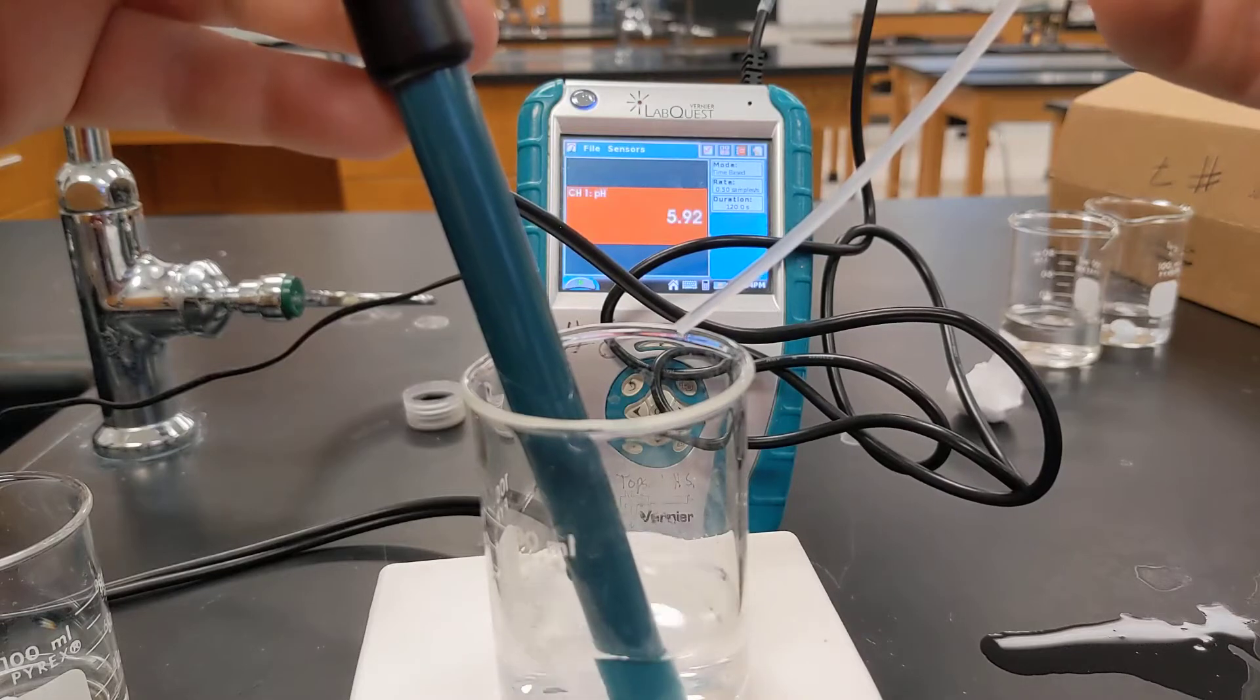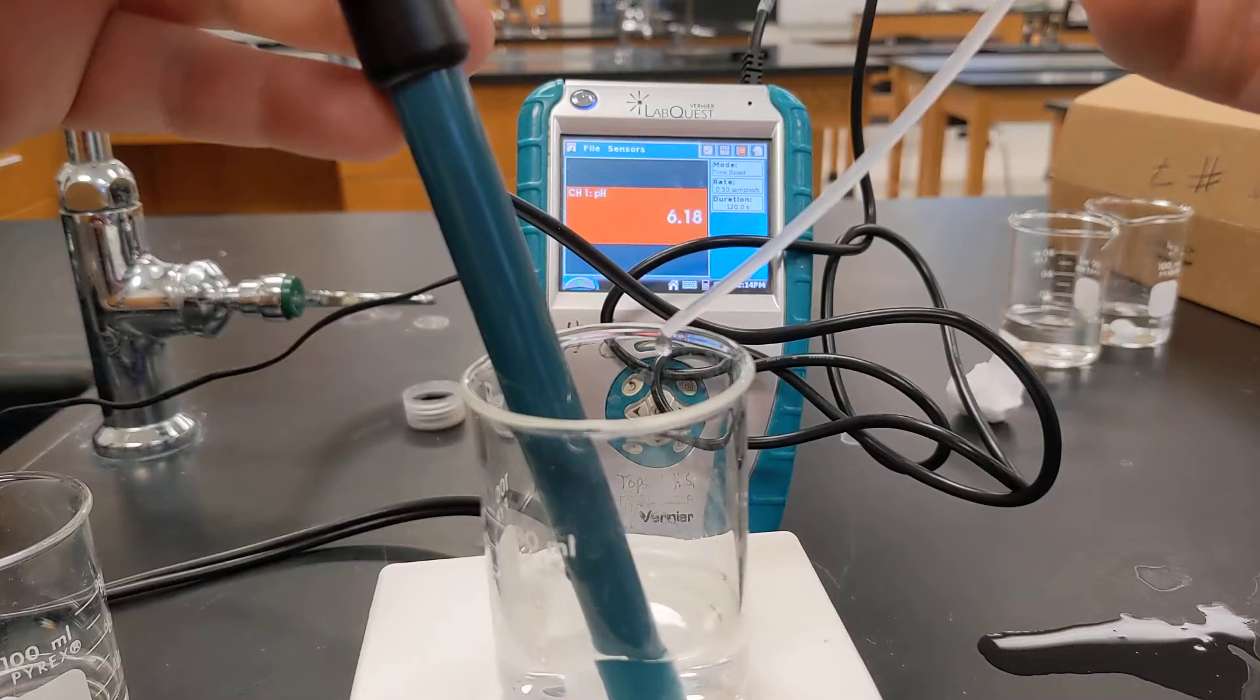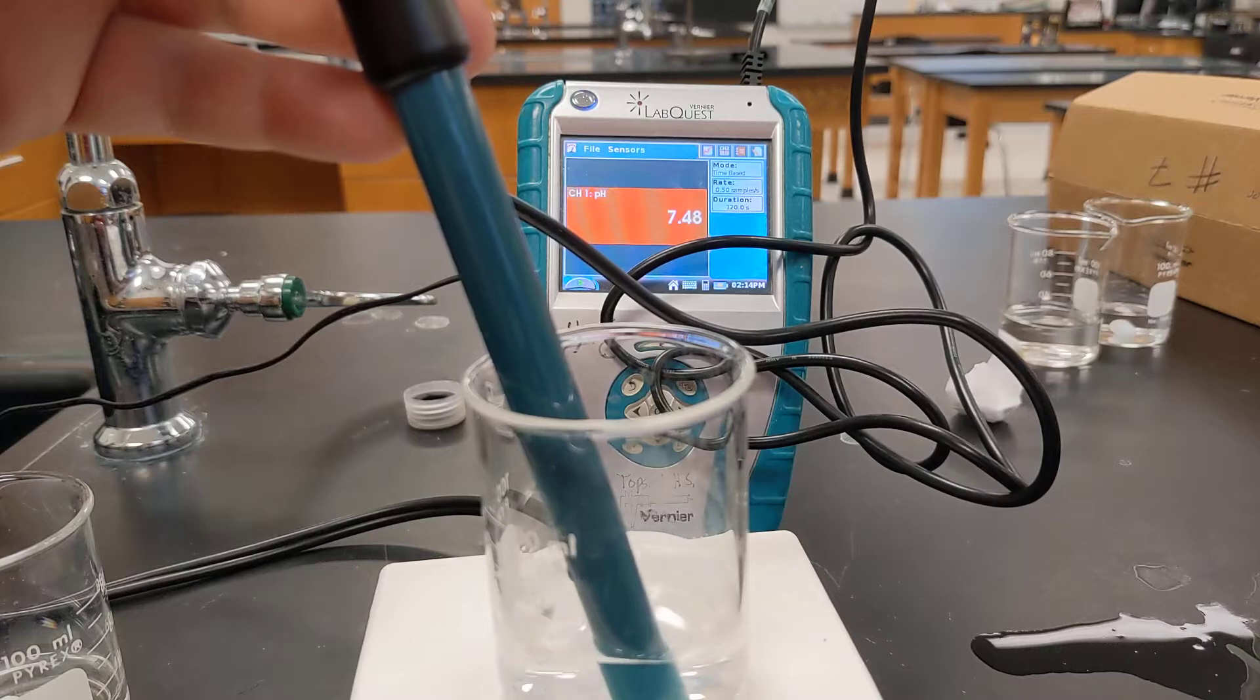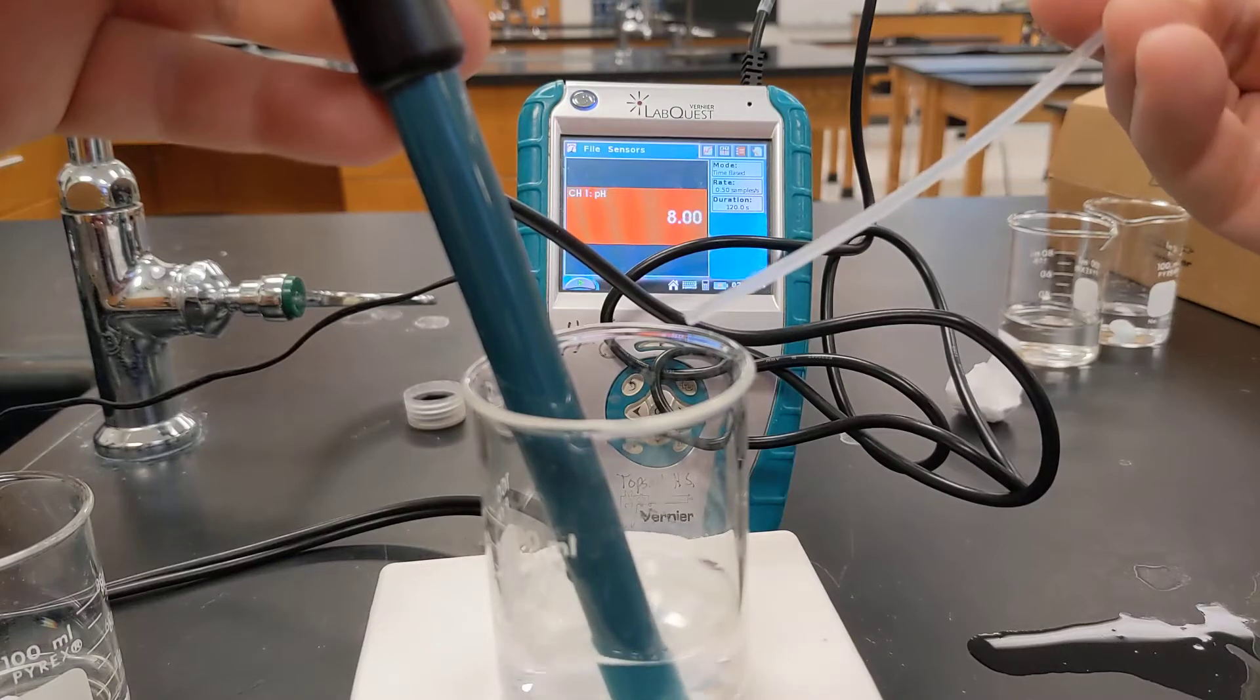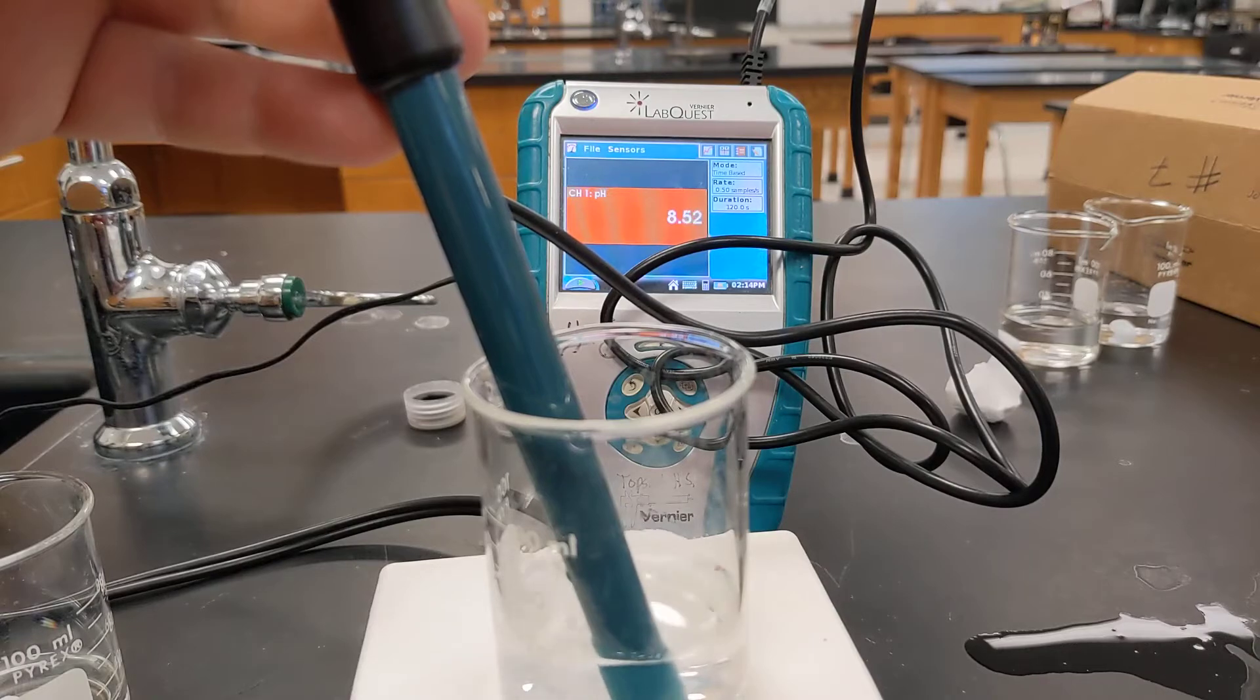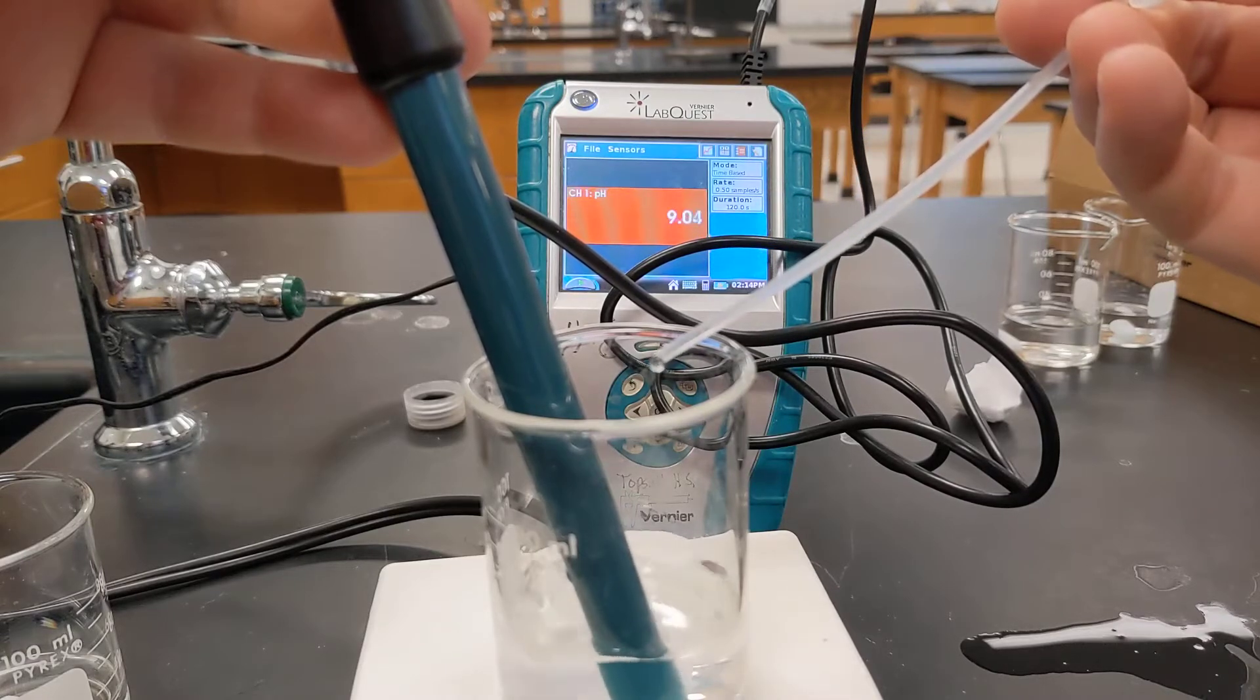These pH meters are a little slow to respond sometimes. Add a second drop. The pH is really climbing on up there. A third drop. A fourth drop.